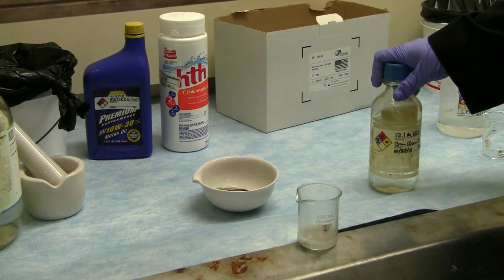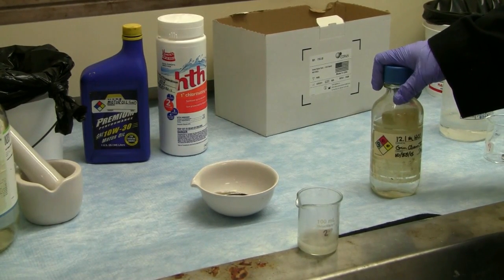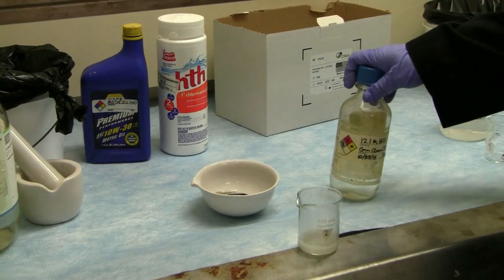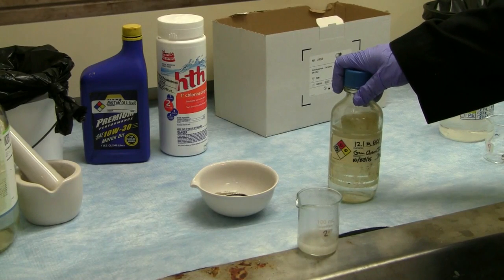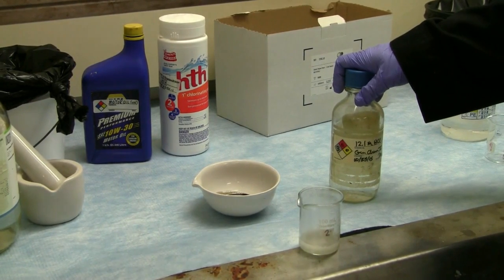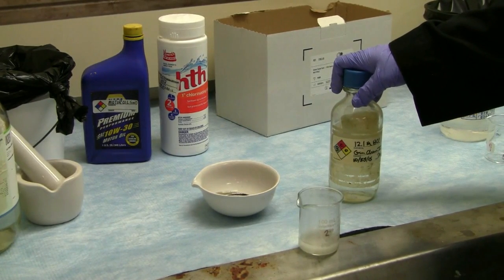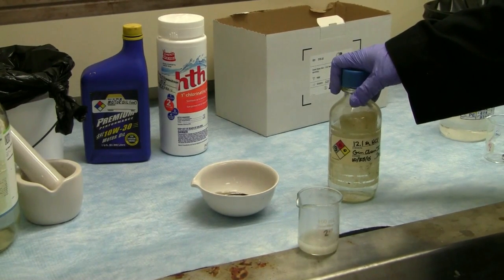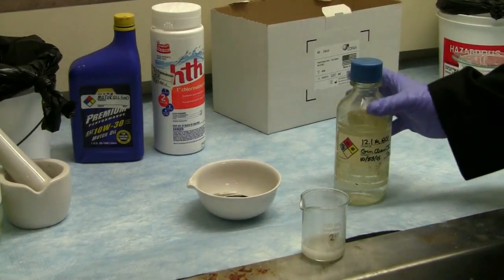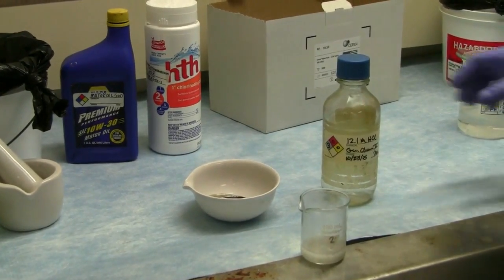And the case here, I remember a story from A&M Kingsville, where some researchers thought that they were storing hydrochloric acid that they had not used yet in a stainless steel dewar, and it was not a stainless steel dewar. It was an aluminum dewar. And when they came back the very next Monday, there was a nice fog of hydrochloric acid vapor and hydrogen gas that they had accumulated in their lab, and it destroyed all their equipment and cost them tens of thousands of dollars to replace all that gear. So it's always important to know what container you're dealing with and make sure it's the proper container with the particular chemical.